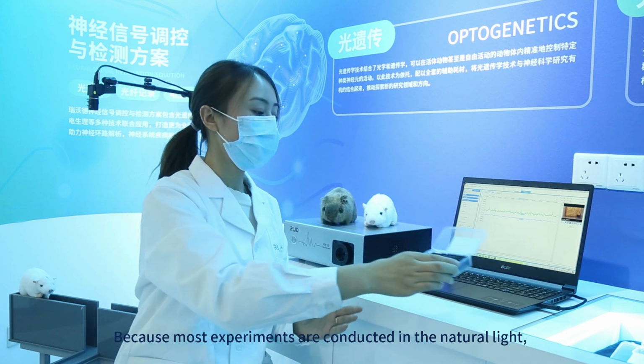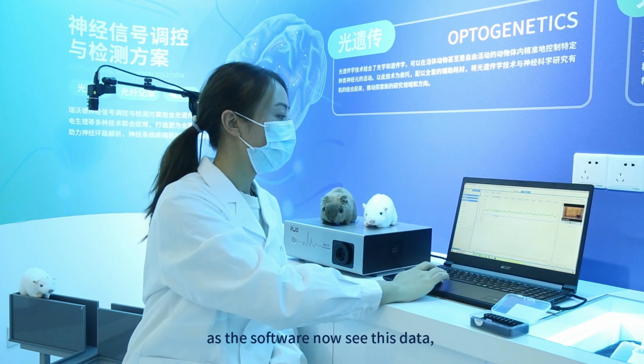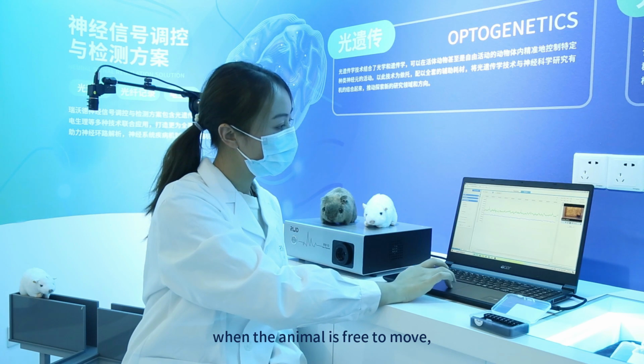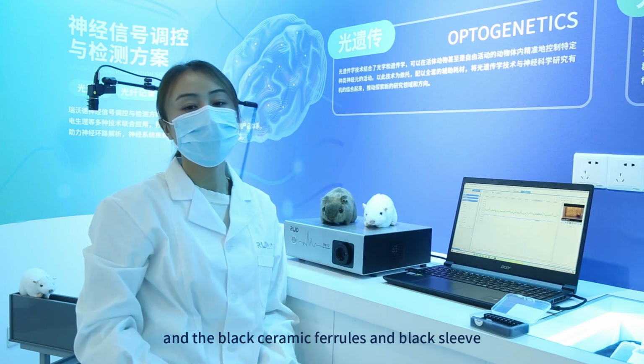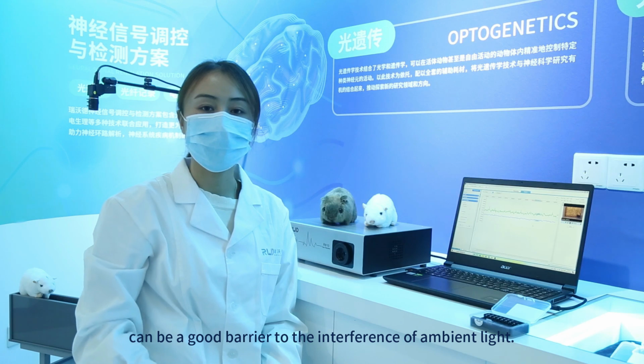Because most experiments are conducted in natural light, when the animal is free to move, the change of light will cause dynamic interference to the signal, and the black ceramic ferrules and black sleeve can be a good barrier to the interference of ambient light.